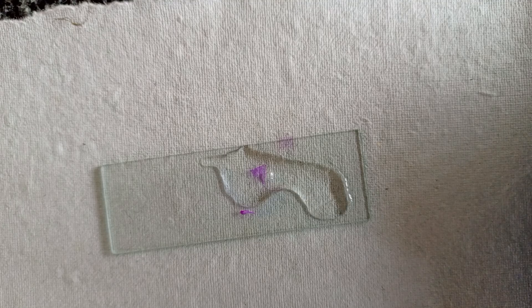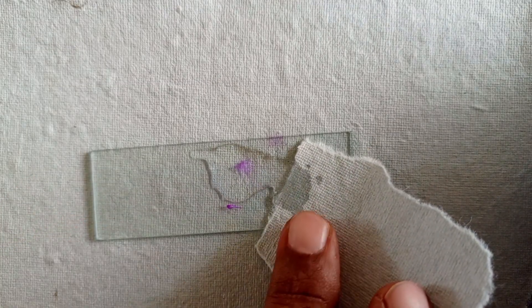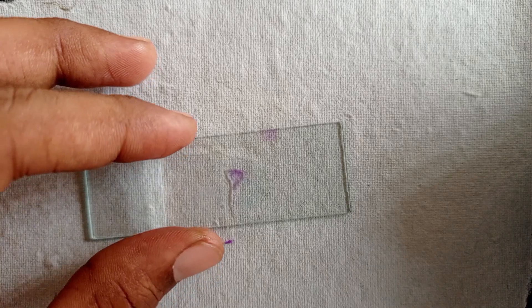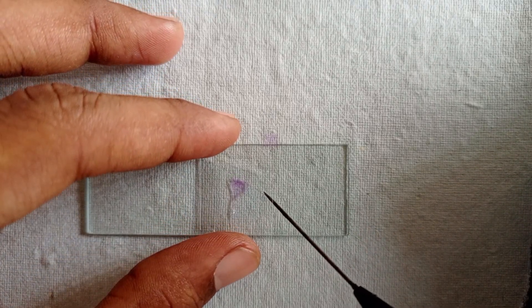Now add one to two drops of water. You can remove excess water with the help of blotting paper. Now add a cover slip with the help of a needle. Now we can observe it under the microscope.